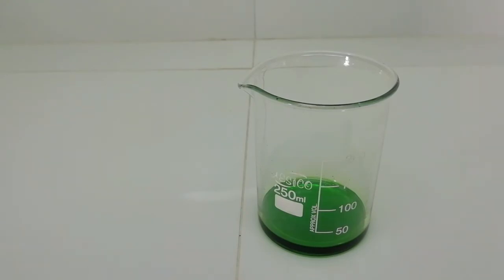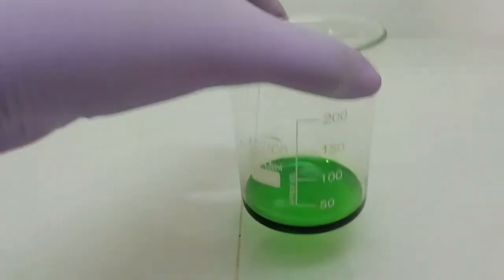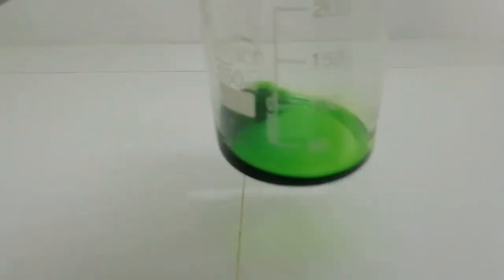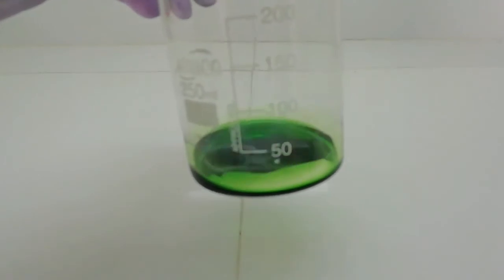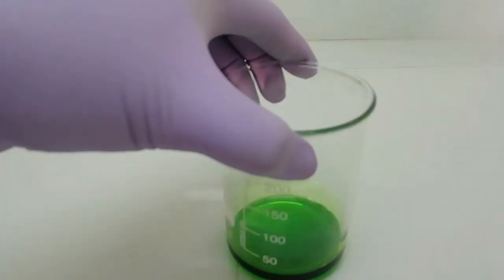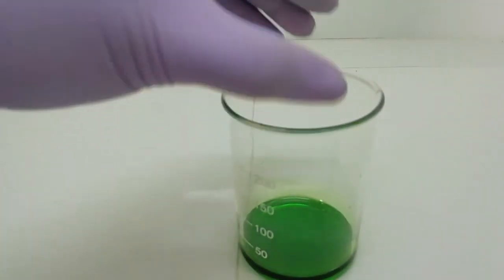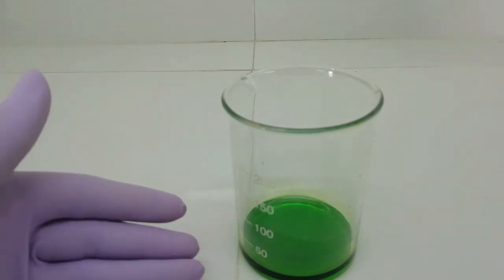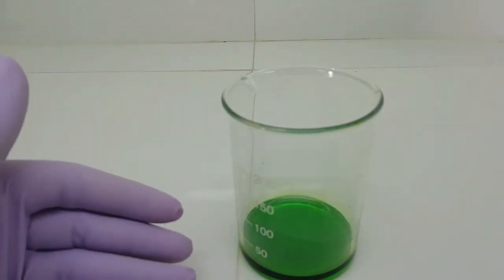After reducing the volume, here is our nickel chloride solution. I just let the solution cool down to room temperature, but I didn't see any crystals forming. So this is a very concentrated nickel chloride solution. Now I am going to remove the rest of the water by keeping this in a desiccator.